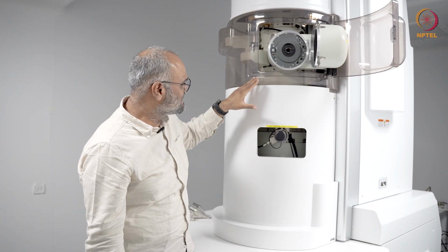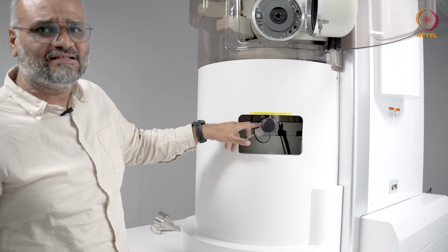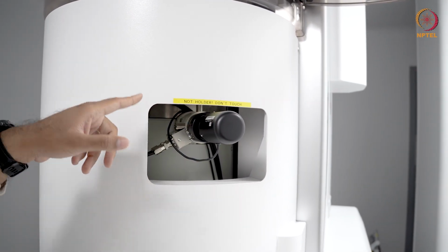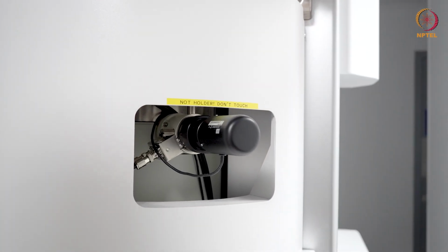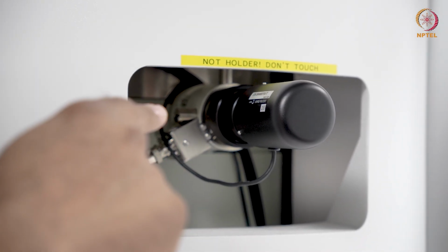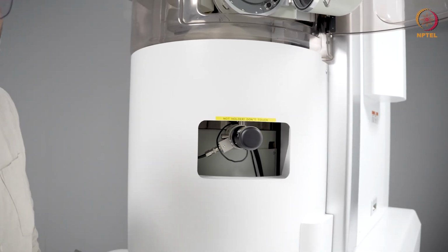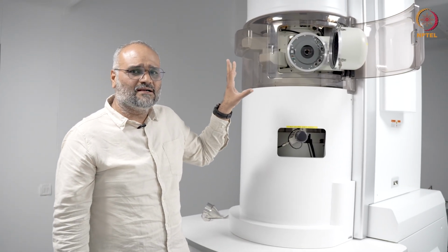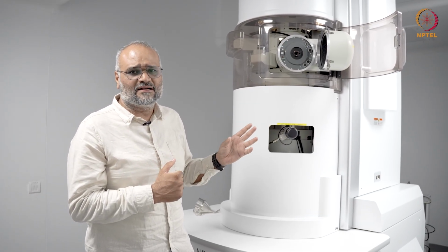And right below the corrector, you have the illumination system and all the lenses. And what you see here is actually a biprism. So this biprism in this particular instrument is actually a platinum wire. You can displace this in X and Y directions and move it inward. And you can apply a potential on this platinum wire. And when you do this, you obtain interference patterns or fringe patterns, which are called holograms. So in this particular instrument, you can obtain spherical aberration free or spherical aberration minimized images in combination with phase images from electron holography.